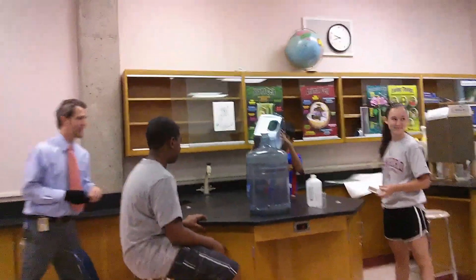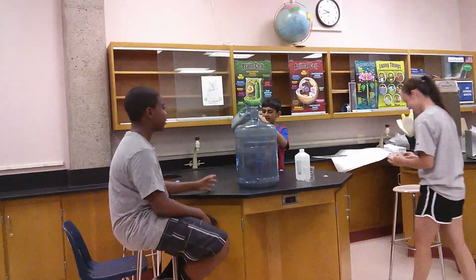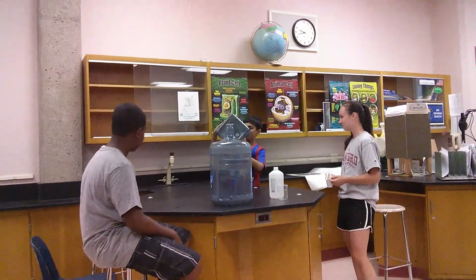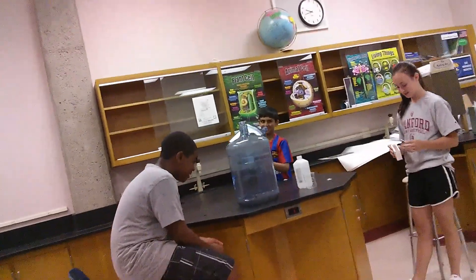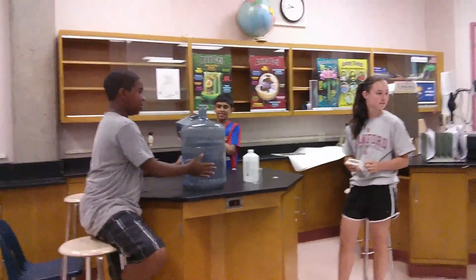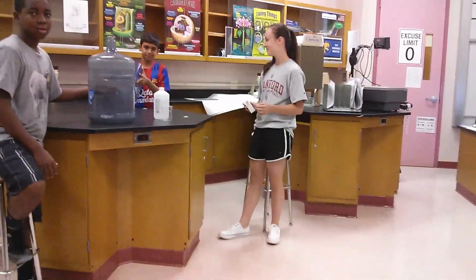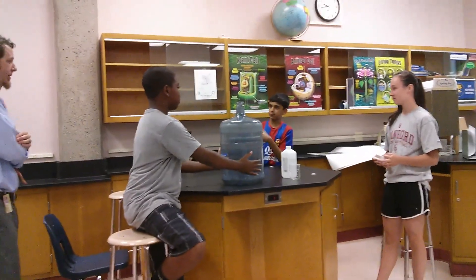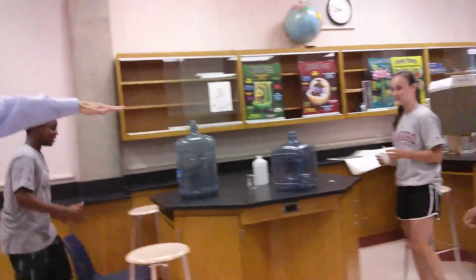It smells like the cow eyeball. You can smell the alcohol — that's because the vapors are getting all the way out here. How far back can you guys smell alcohol? Can you smell it all the way over there? Let's set it at the edge of the lab table. I'm so scared. Step back. Turn the light off.